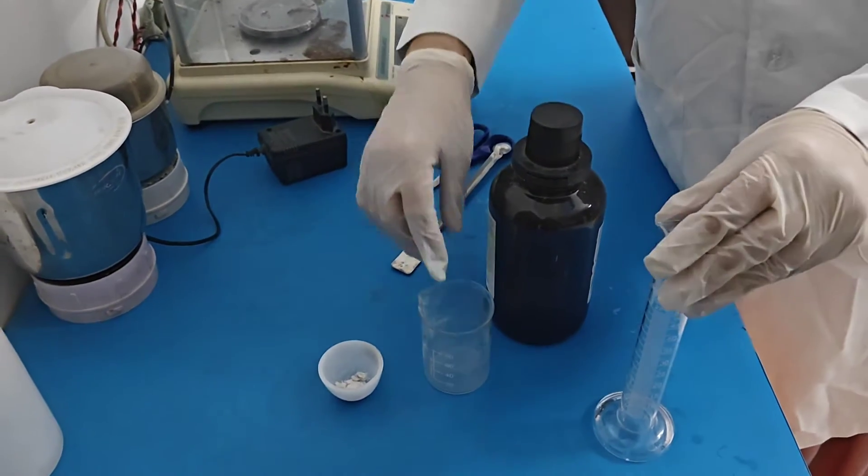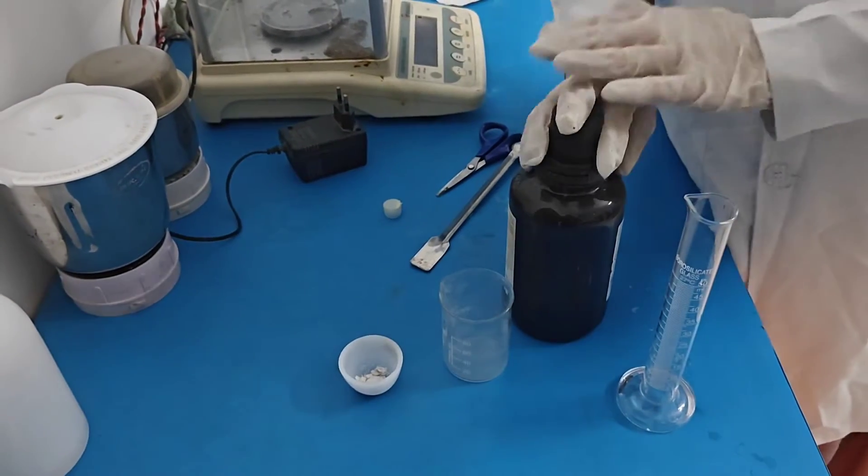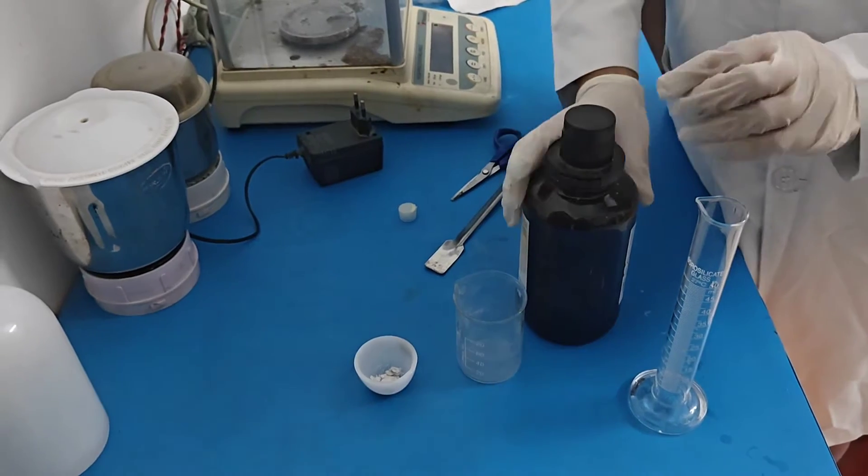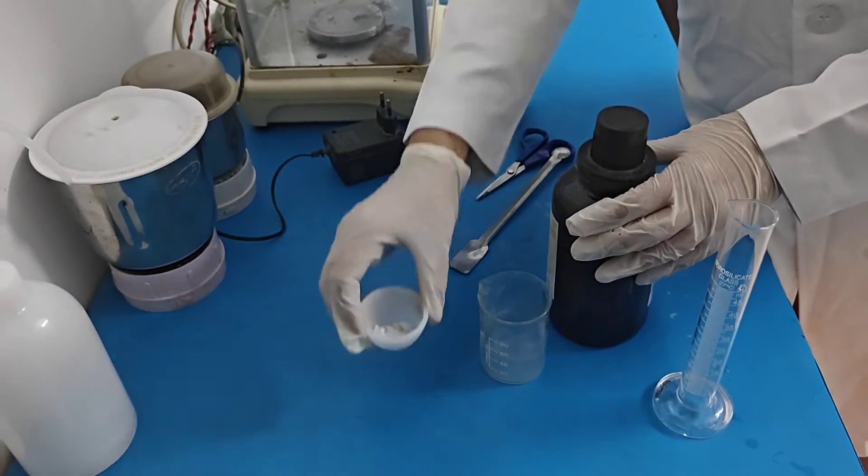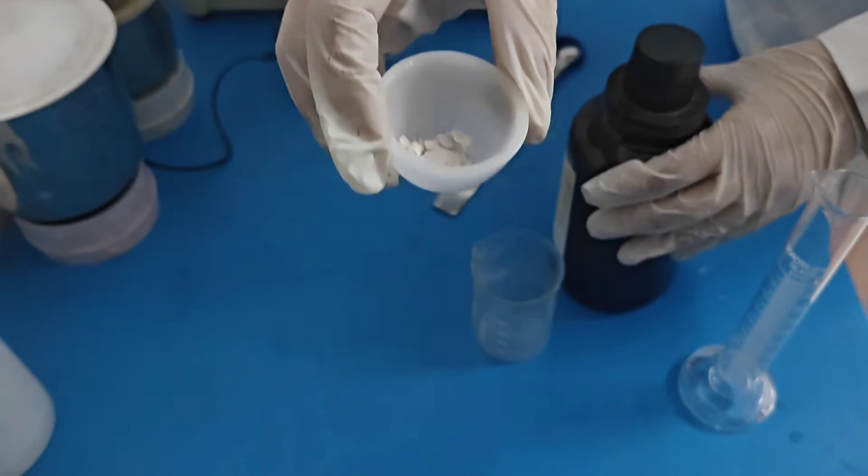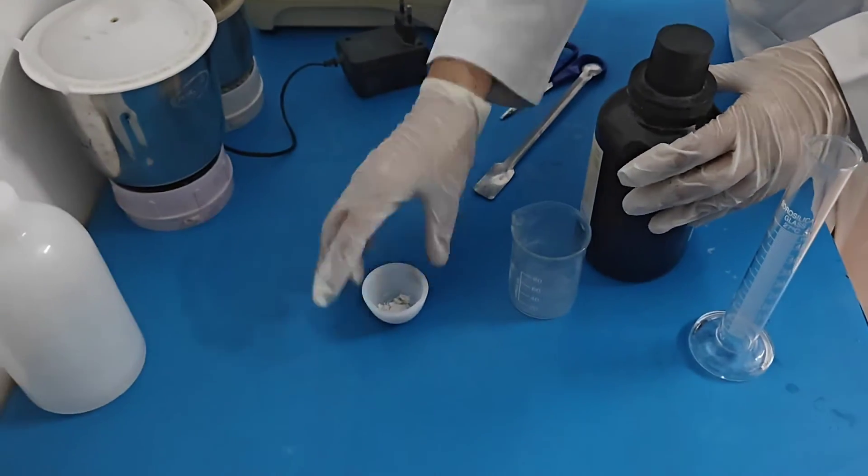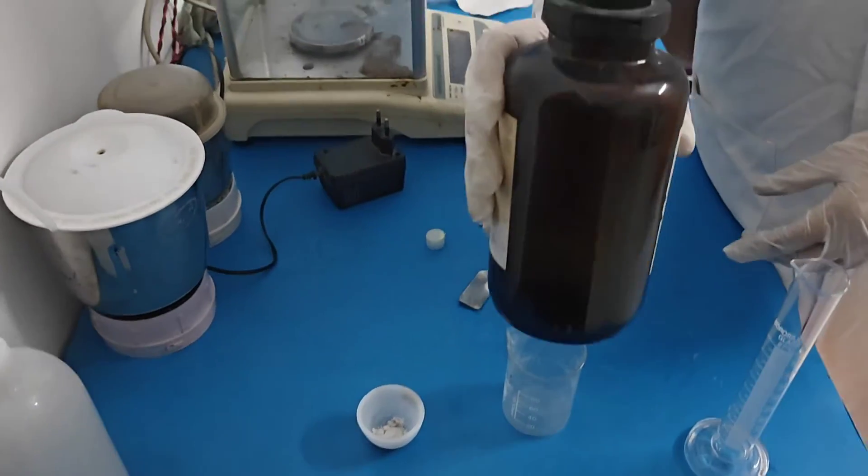Hello everyone, today we are going to perform estimation of acid insoluble ash. For this process we require ash which is already estimated by the wheat flour, and HCl reagent is required.